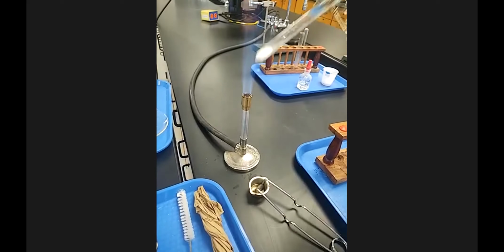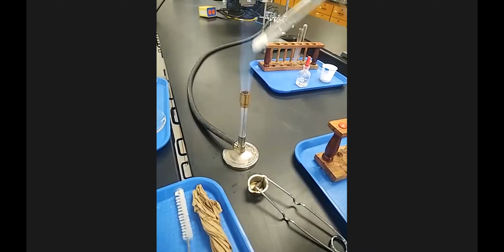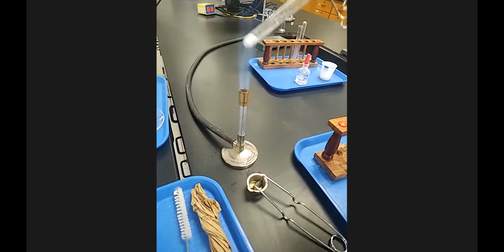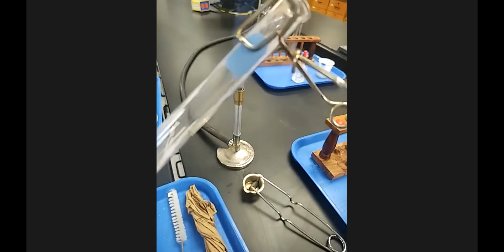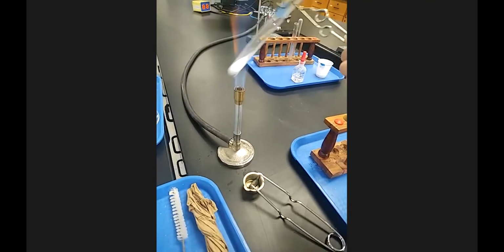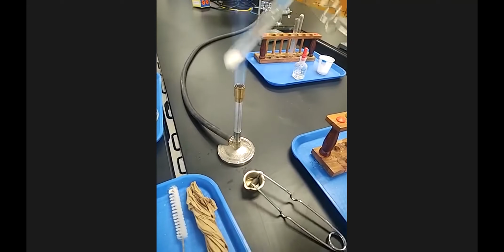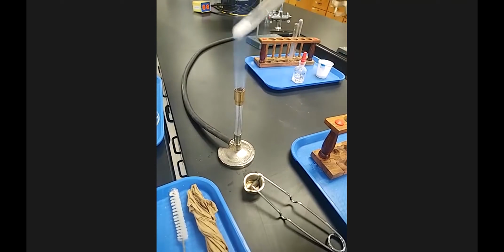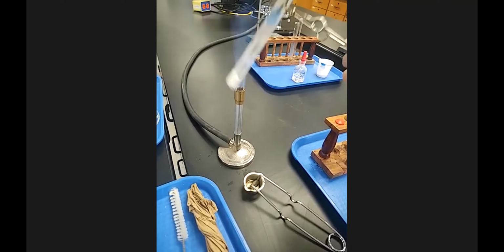When you bang glass on the Bunsen burner, it does not like it. So heating this, swirling it, and then I'll pull it out here. Nothing that dramatic yet, but it doesn't hurt to pull it out every 10, 15 seconds and view it. I can't really see it any better than you can right now because it's being swirled, but you can see that white powder going up and down my test tube. Now we can see something though.